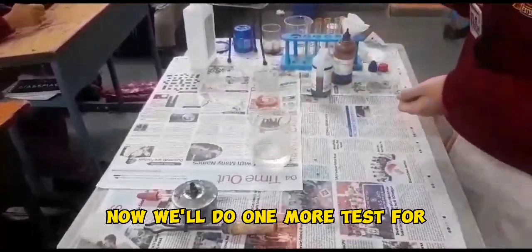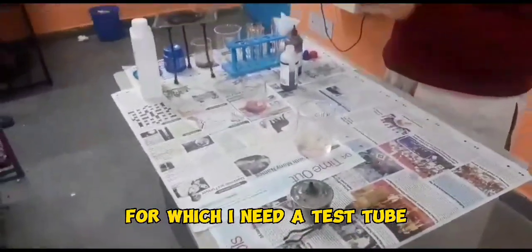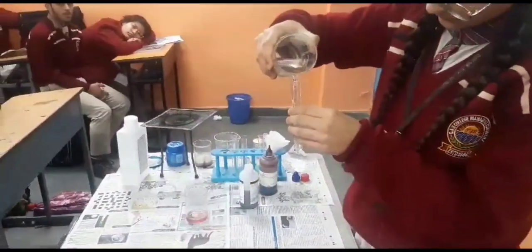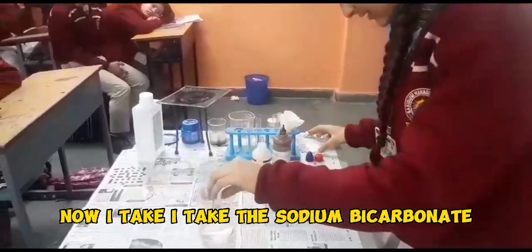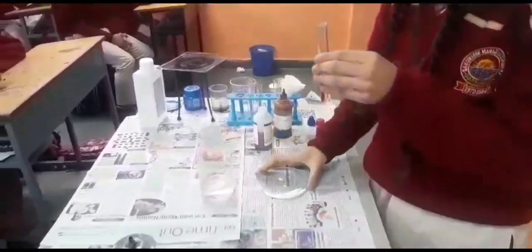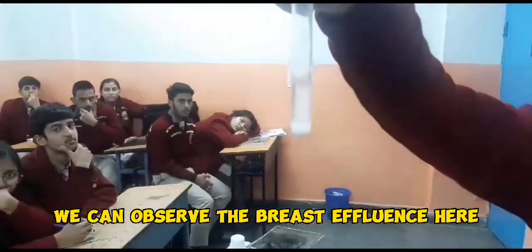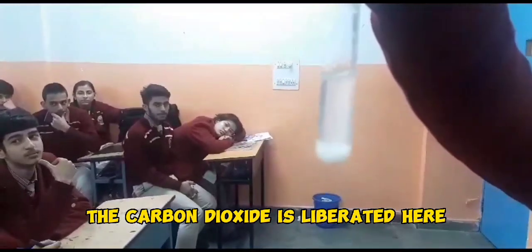Now we'll do one more test, the sodium bicarbonate test, for which I need a test tube. I'll take this ethanoic acid and pour it into the test tube. Now I'll take the sodium bicarbonate and add it to it. We can observe brisk effervescence here, which clearly depicts that carbon dioxide is liberated.